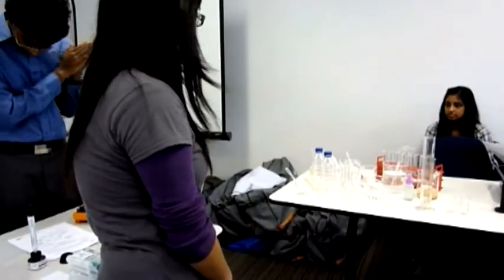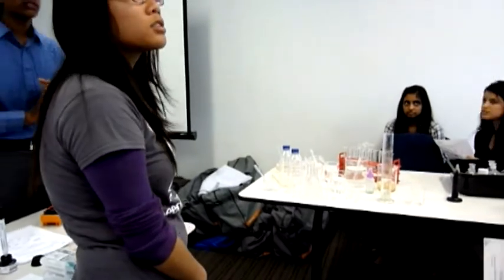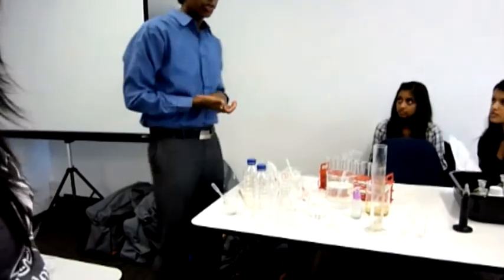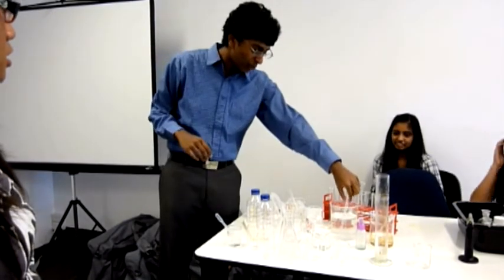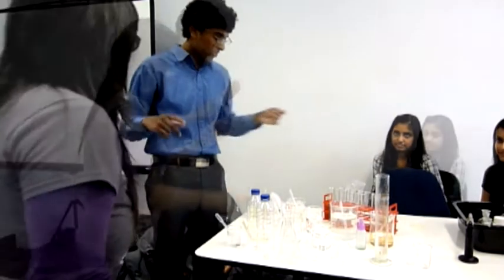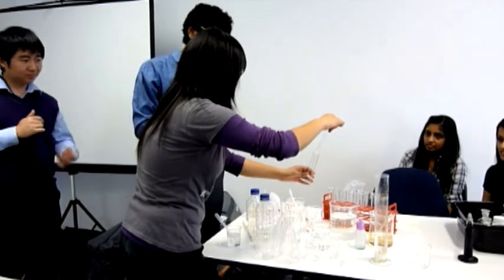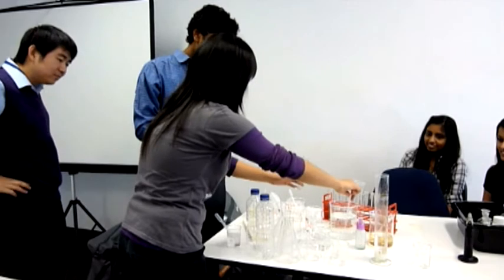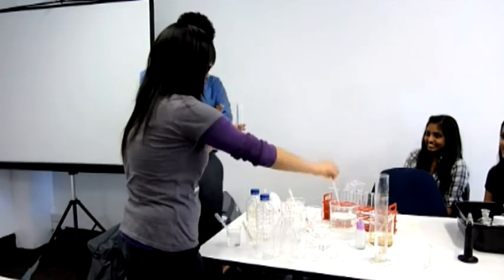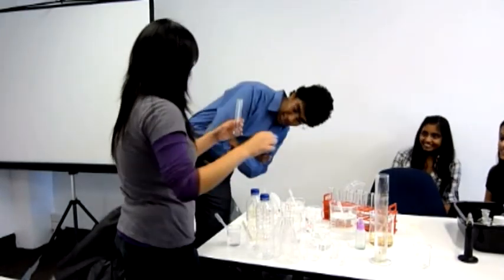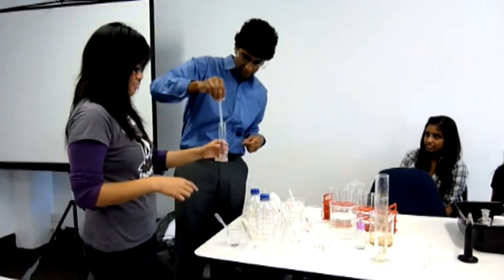Sulfate, we're going to test for sulfate. So we can just use that solution. The one that we just used, yeah we could. We'll try again. Three squirts. We're going to be filtering it. Or you could add one more because we'll be filtering this one, so we may as well.